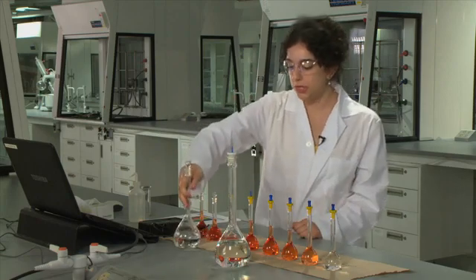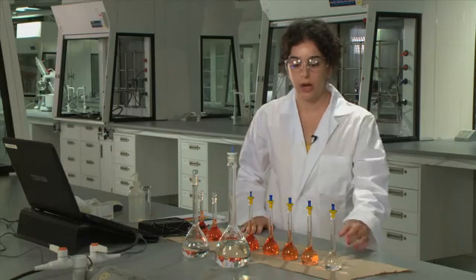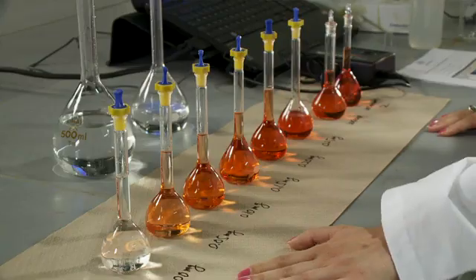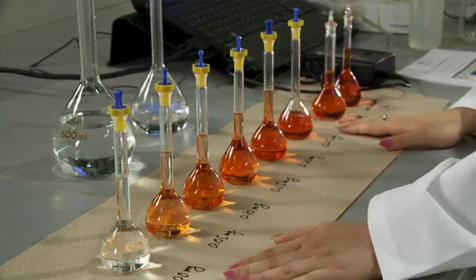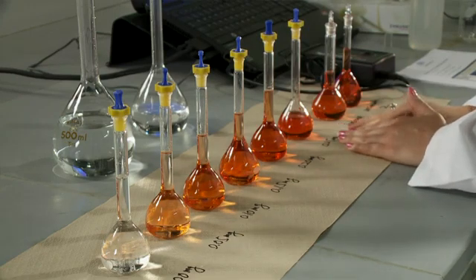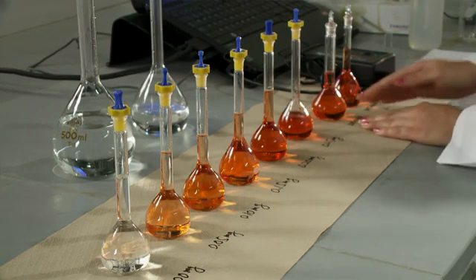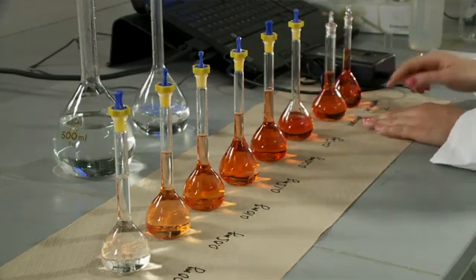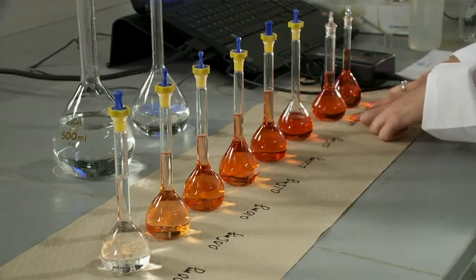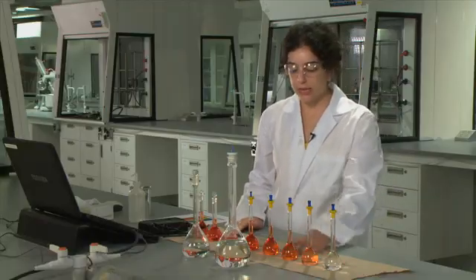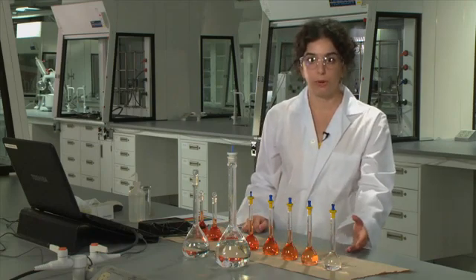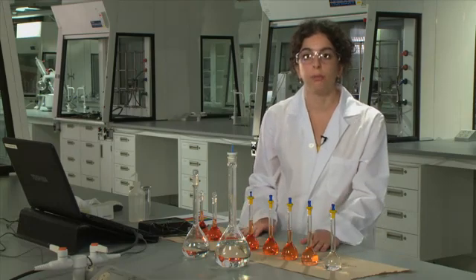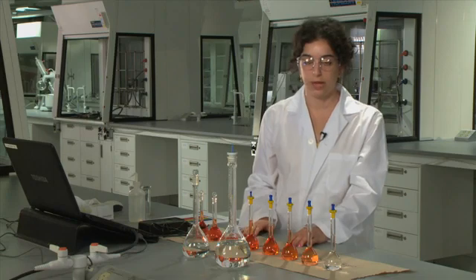When you've prepared these solutions, they'll be transferred out into a series of 50 milliliter volumetric flasks, shown here. The standards will contain different amounts of the standard iron added to the flasks. The unknown will be a certain amount of iron from your unknown sample, and that will be transferred in two 50 milliliter volumetric flasks. To the standard solutions, as well as the unknowns, you're going to be adding a couple of reagents before preparing them to the markings on the volumetric flasks.